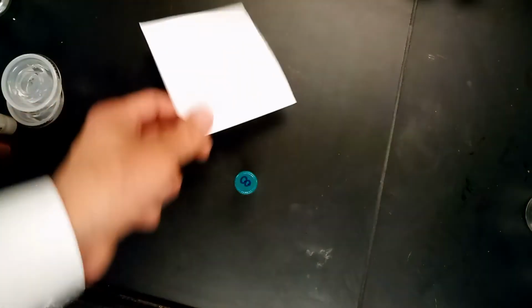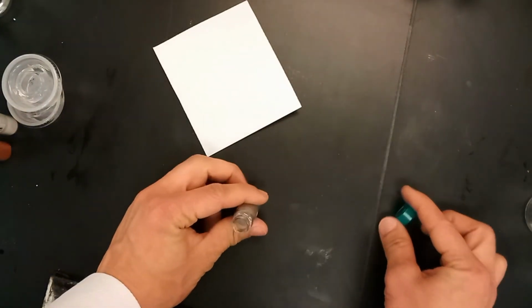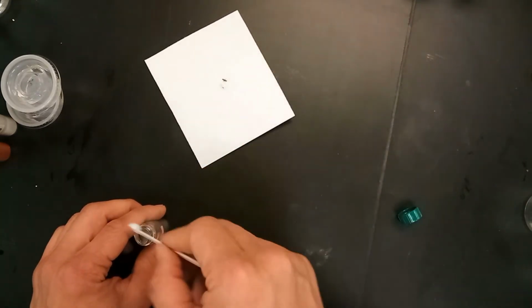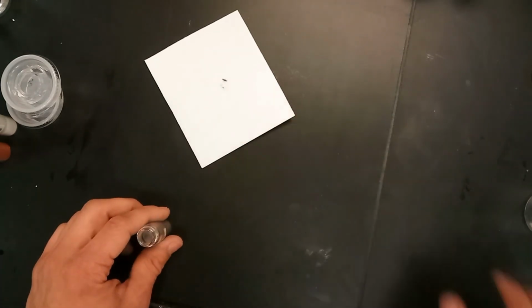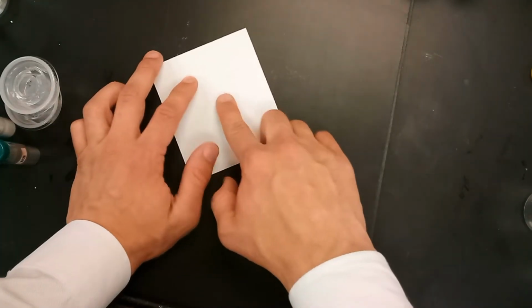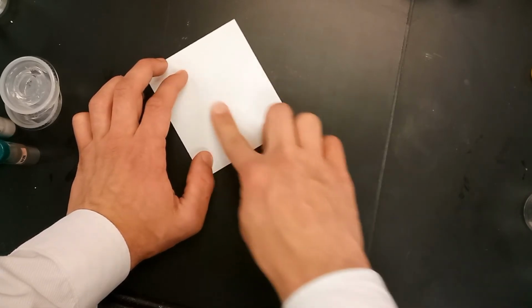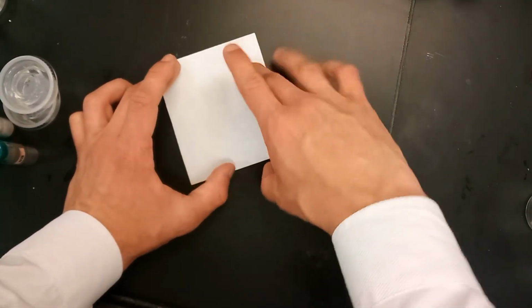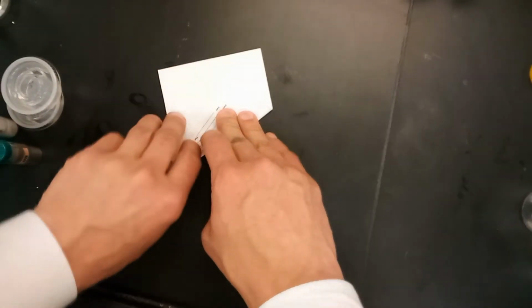And the second thing that we want to do, even though we already know that it's magnetic, which gives us a pretty good indication of what it is, is test whether or not we can write with it. So a small piece of paper here. Just get a few of the pieces of this metal on there. Close this up so if we spill it, it doesn't spill. And just go ahead and try to write with it. No, the answer seems to be no. This is not something we can really write with, which is what we expected given that it was magnetic.